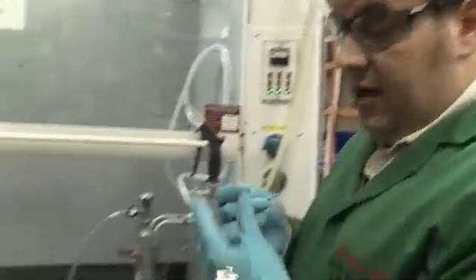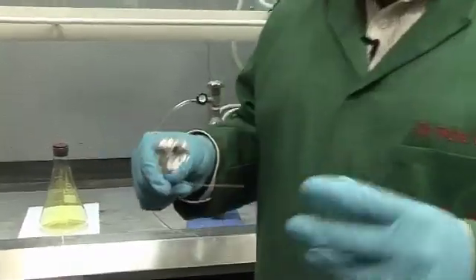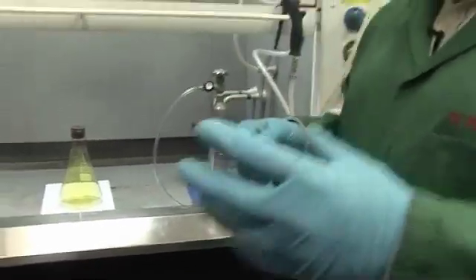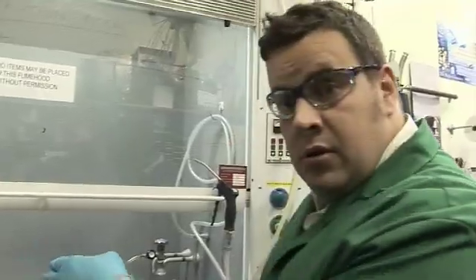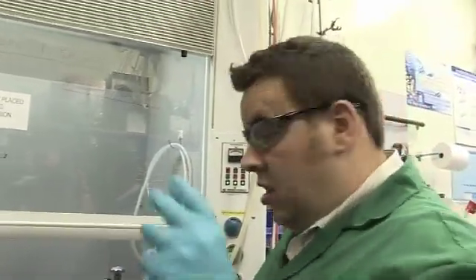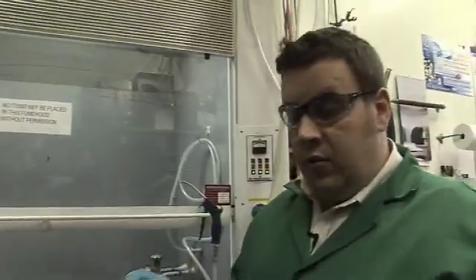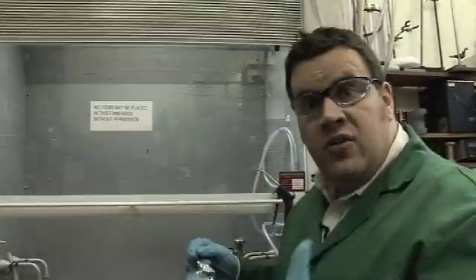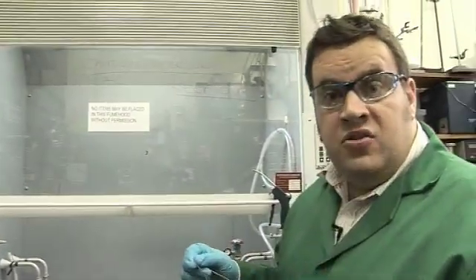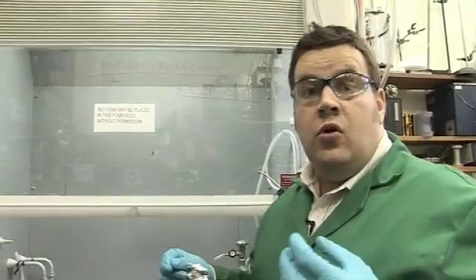So we have a small amount of aluminium here, which we put on the end of a wire. We're going to heat the aluminium in that flame and then we're going to put the hot aluminium into the flask of chlorine. Then hopefully we'll see the chlorine will react with the aluminium and we'll get very rapid formation of aluminium trichloride, AlCl3.